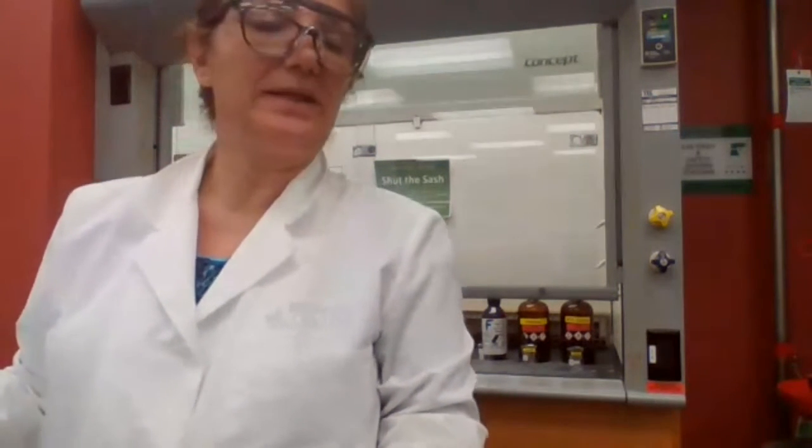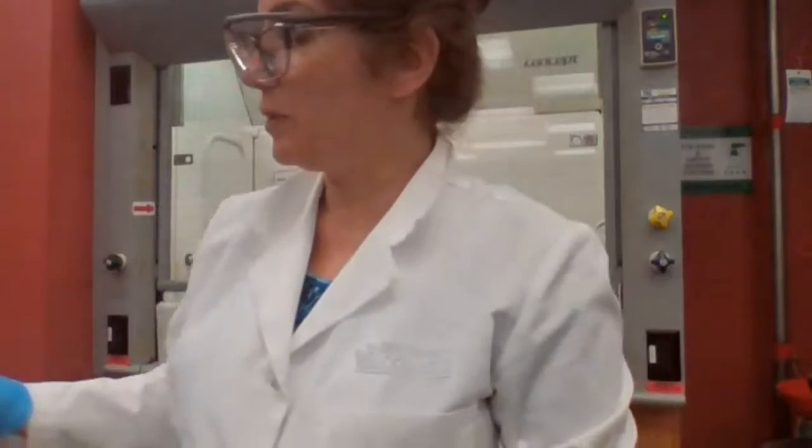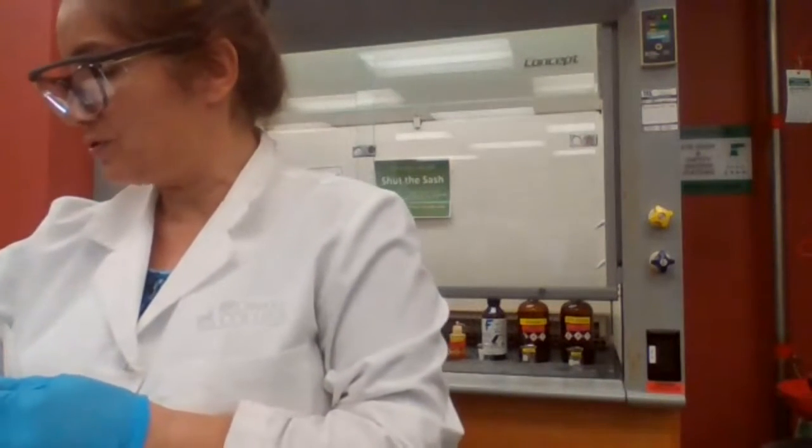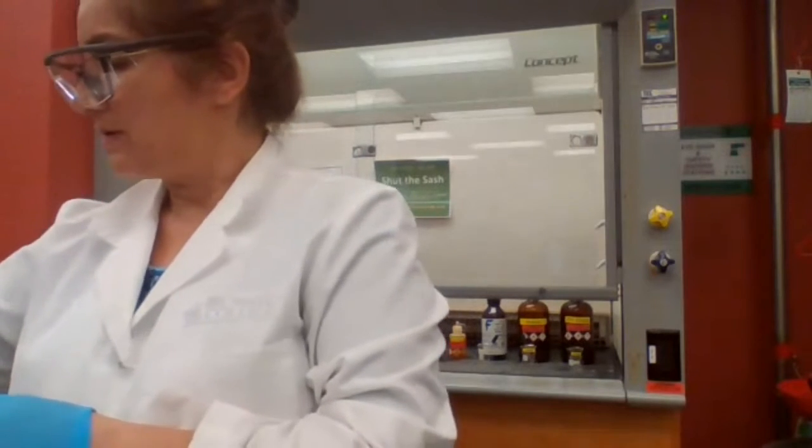Next, Jones oxidation. With the Jones oxidation, your reagent is basically chromic acid, and chromic acid is an oxidizing agent. What do you expect? Can you tell me what you expect from this reaction? I want to know, you already have read the experiment, or hopefully this was covered in your lecture already, and you remember it. I'm sure it was covered.